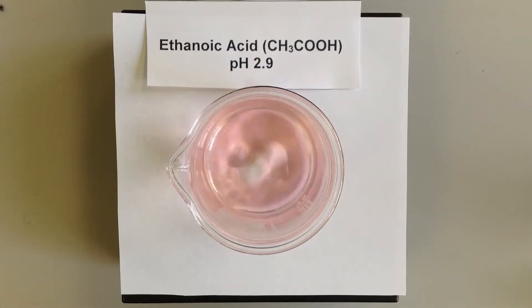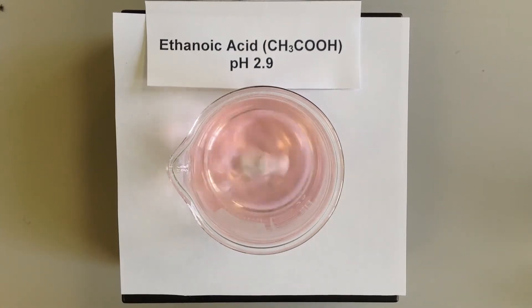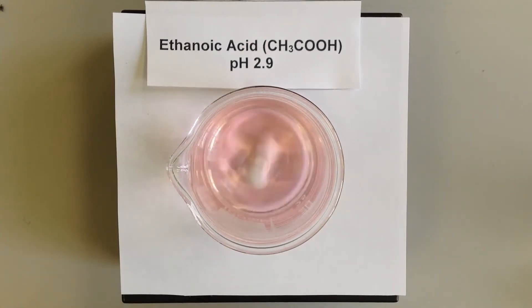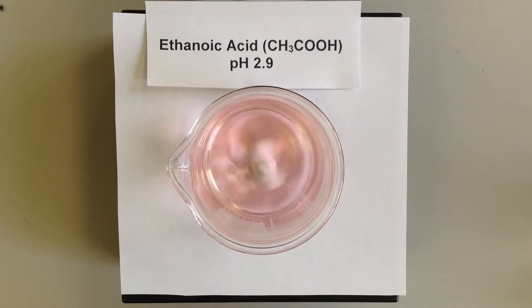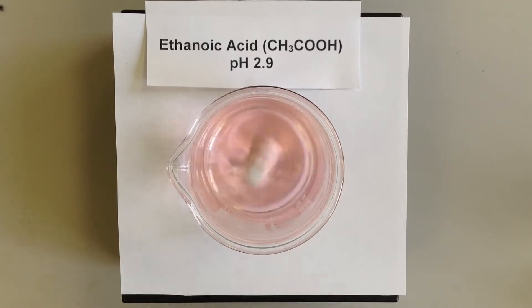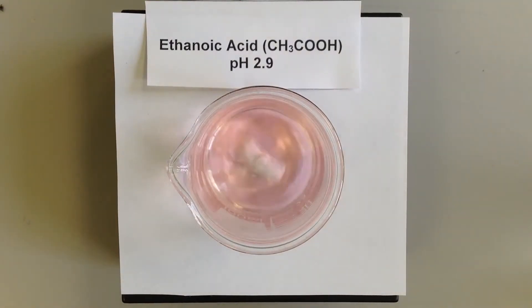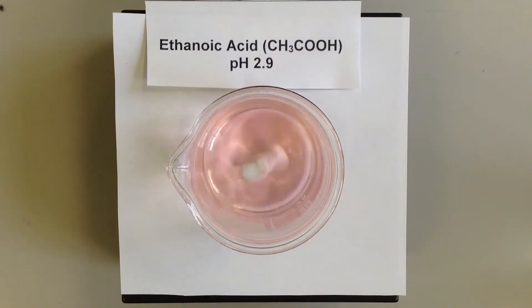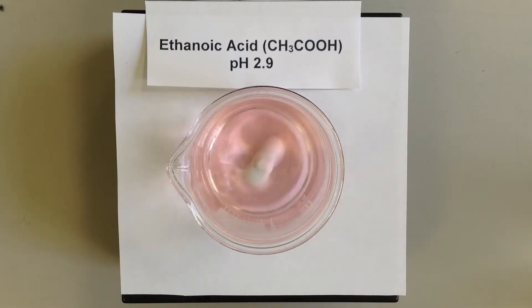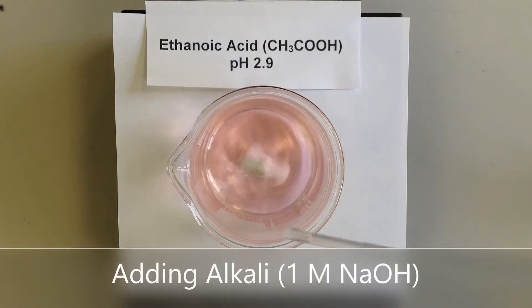In this demonstration, I'm starting with a solution of ethanoic acid, 0.1 mole per decimetre cubed, which gives a pH of 2.9. And I'm going to add to this some sodium hydroxide and see what happens to the pH as I add it dropwise.